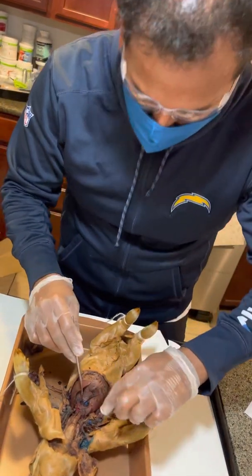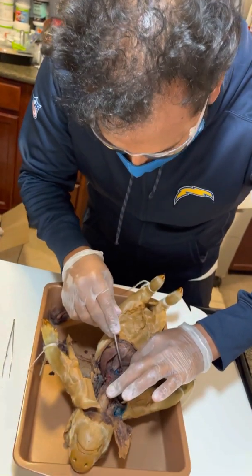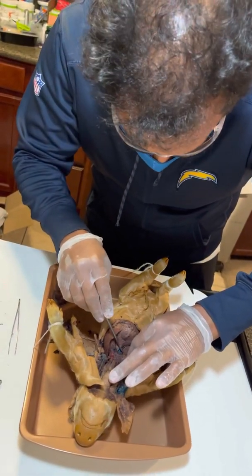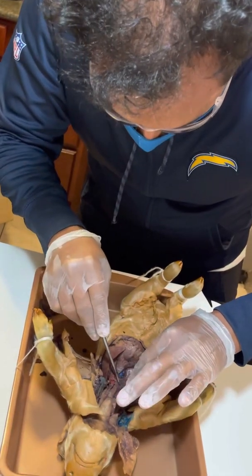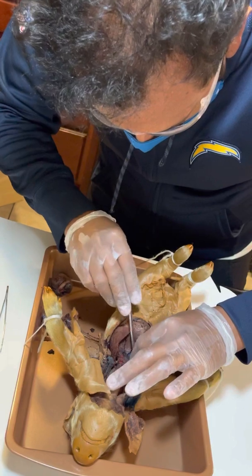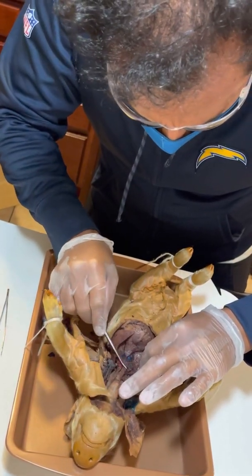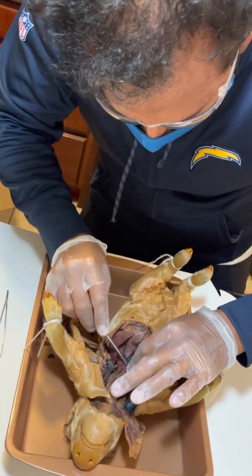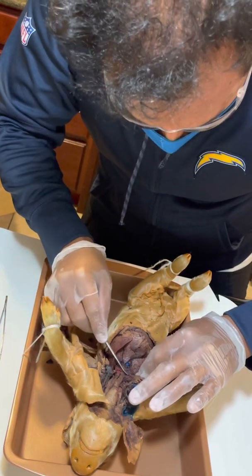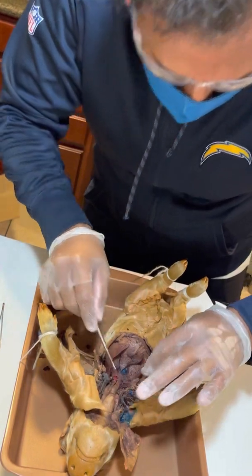Okay, the hilus is actually a lot more prominent in humans. The hilus encapsulates the bronchial tube, and it's what holds the lung in place, and that is this little guy right here that I actually just tore. So it holds the lung in place. This is the hilus, or hilum.